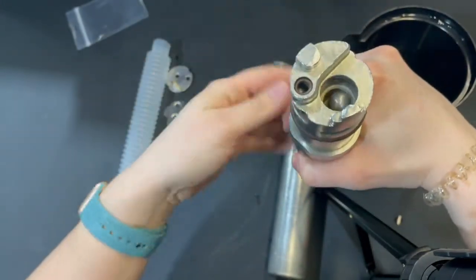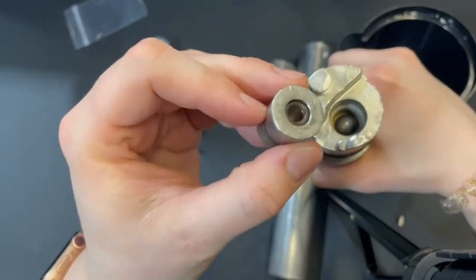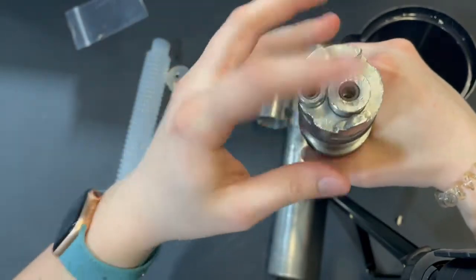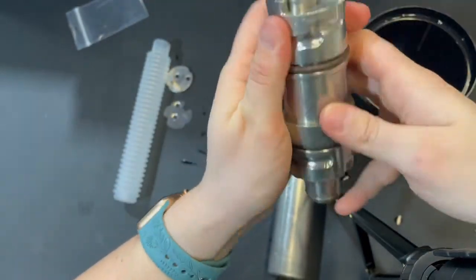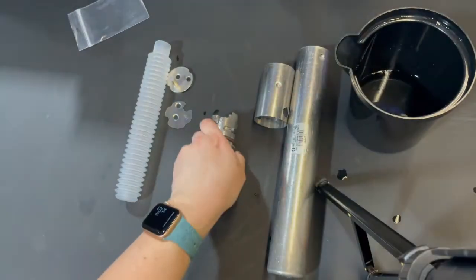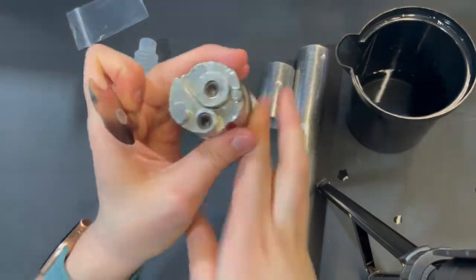We're going to take a ball and place one on the top as well. Then we're going to insert this metal piece on top of that. Again, make sure it sits flush. It should kind of click in and it should not be loose.